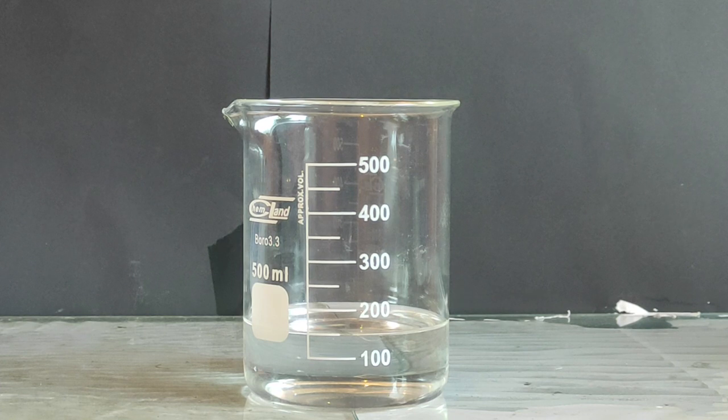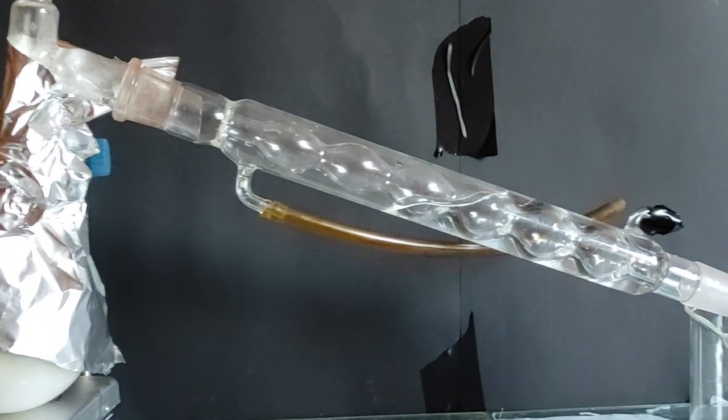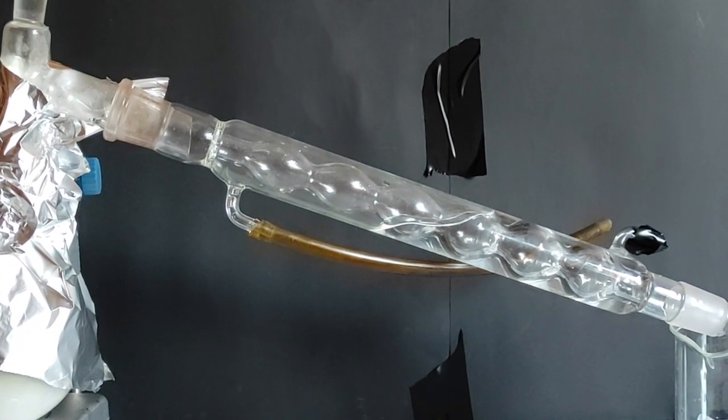Now run the distillation for 2-3 hours and you've got your clear acid. You can run another distillation to concentrate the acid.